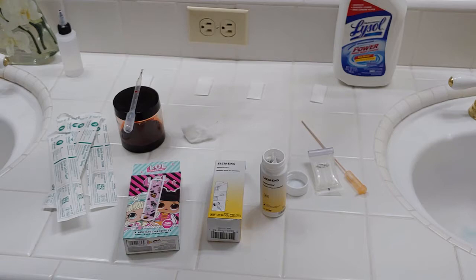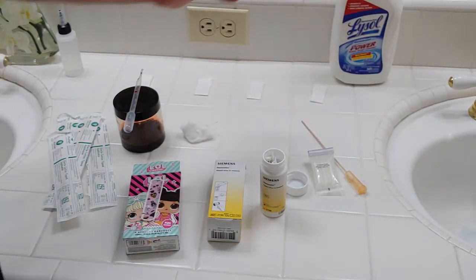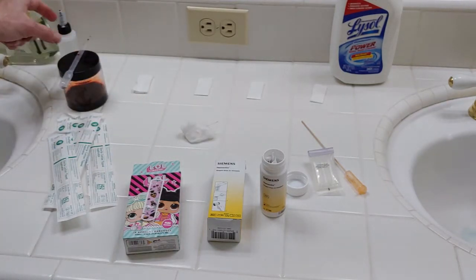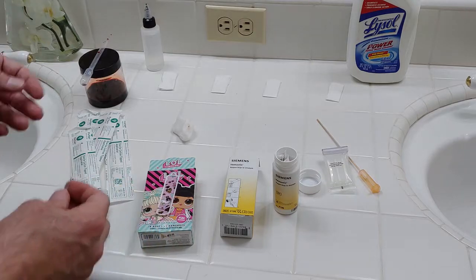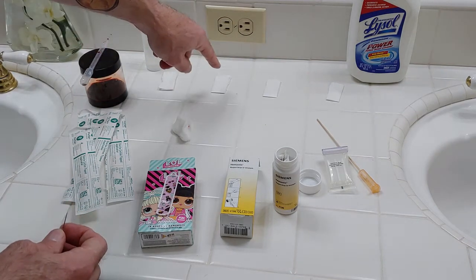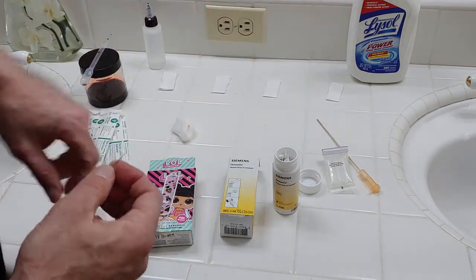I've also got some Lysol, and this one contains hydrogen chloride, so we're going to see if this gives us a false positive. I've got my four cotton swabs and distilled water, which is what we would use to collect dry blood stains. We're going to do all this testing on wet stains, placing our samples on four different cotton swabs: real human blood from myself, synthetic blood, distilled water as a control, and Lysol on the final one.